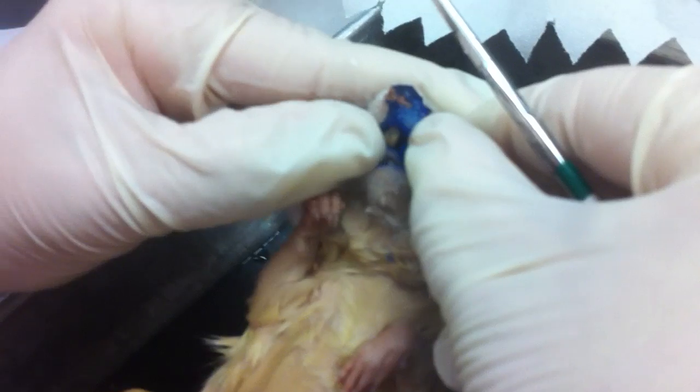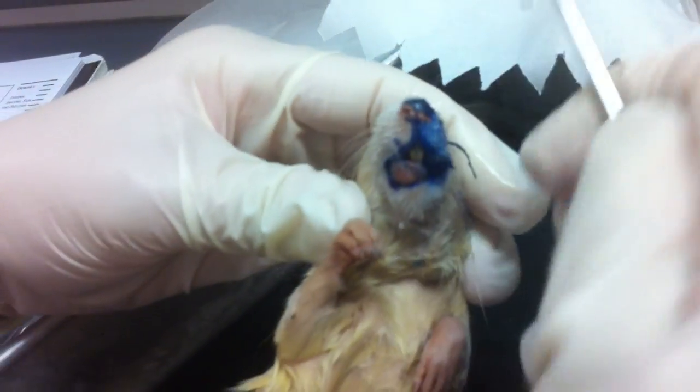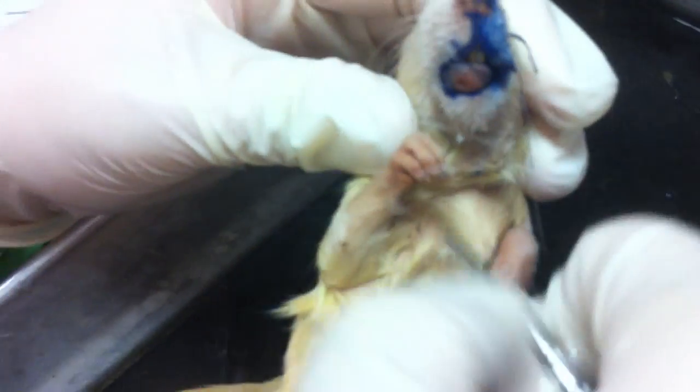The little part in between the upper lip is called your philtrum. If we pull apart the philtrum, you can see the upper incisors. This is your mouth. Here's our little Delilah's tongue.